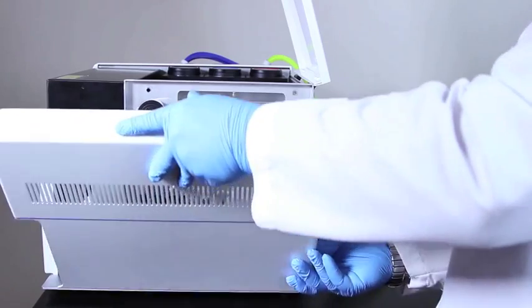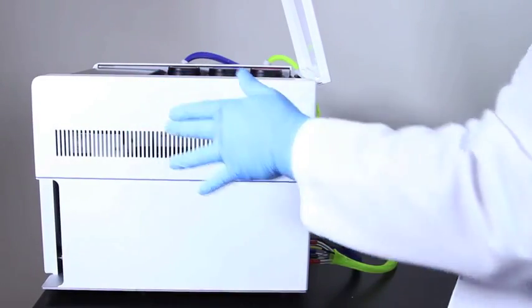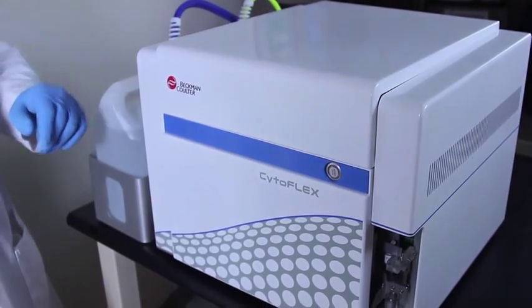Once you have completed the maintenance procedures, reattach the right side of the panel and close the top cover of the CytoFlex flow cytometer. This ends the CytoFlex maintenance procedures.